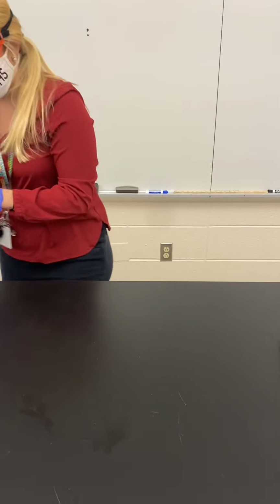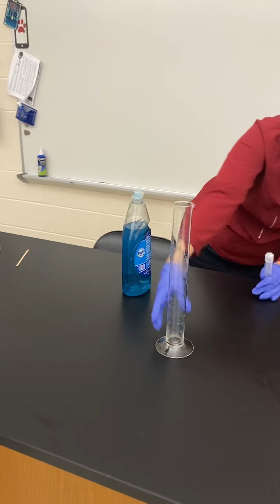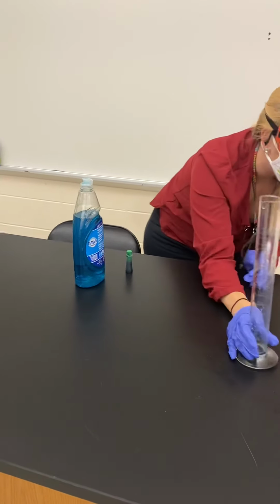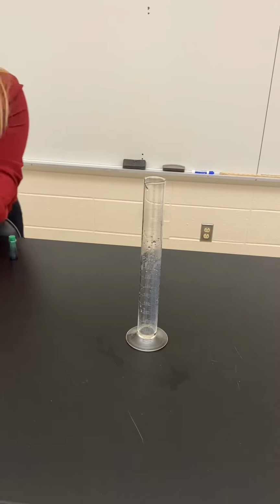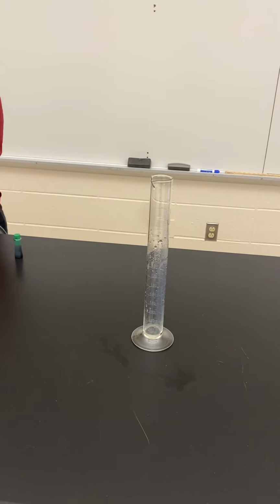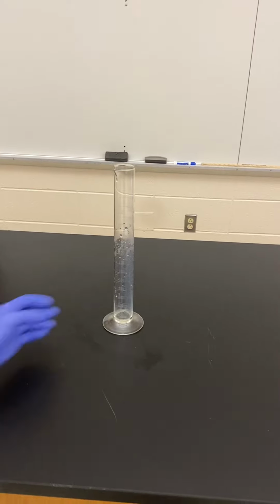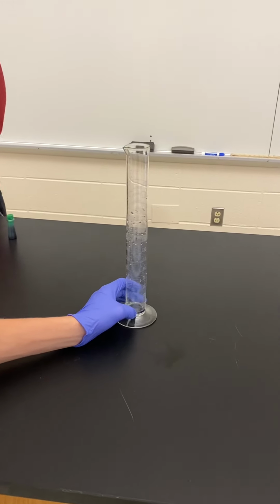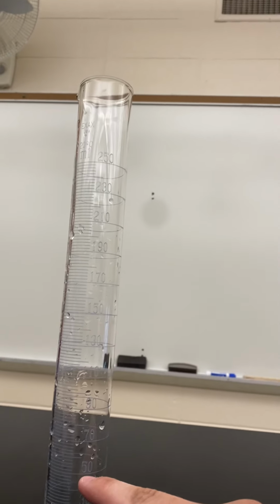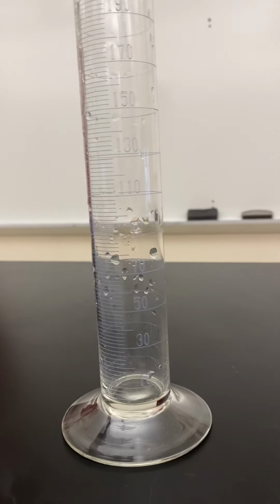So, Joe, why don't you open up the peroxide carefully, and we're gonna pour about 50 milliliters into the graduated cylinder. We'll get it to be a little bit closer. One of the products of this reaction is oxygen. So it's a gas, go ahead and pour it. In order to help capture that gas, we're gonna use soap. So I'm gonna have Joe put in the hydrogen peroxide, and Nick, you're gonna put in the soap right after. About 50 milliliters. Doesn't have to be perfect.